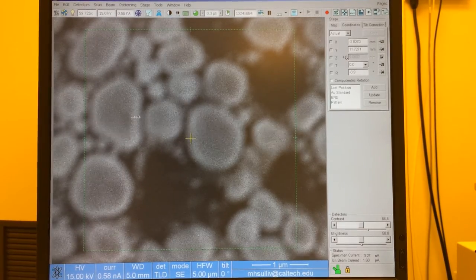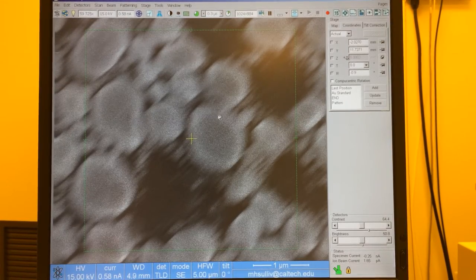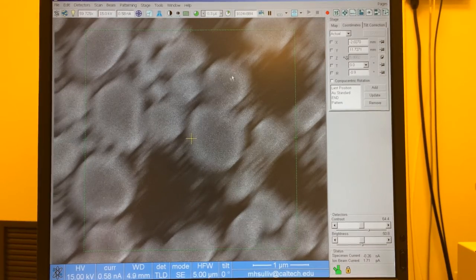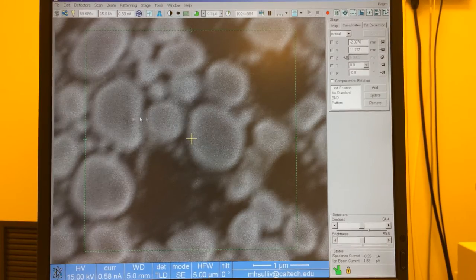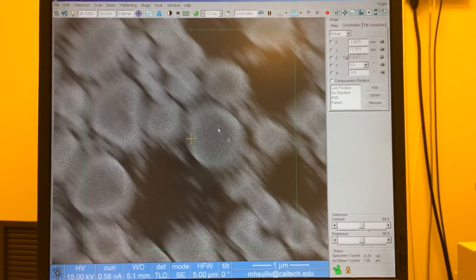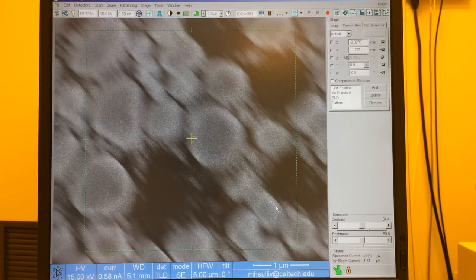I can show that by focusing to the left, where I can induce a diagonal stretch in this case, and that's showing me I have astigmatism. I can prove that by going to the right of focus, focusing towards the right here, and now I've gotten that stretch to rotate 90 degrees. It's now stretching along this axis.